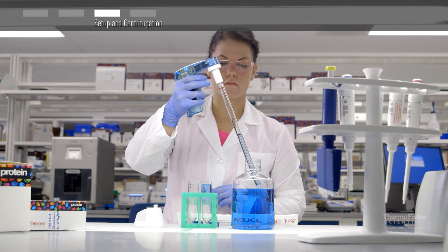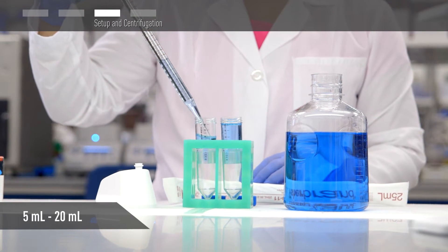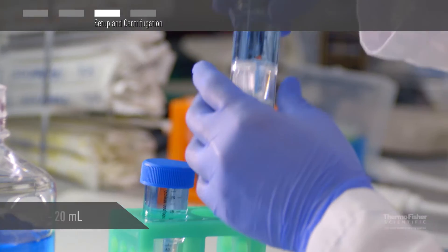To concentrate your protein or proteins of interest, place between 5 mL and 20 mL of sample into the sample chamber and cap.